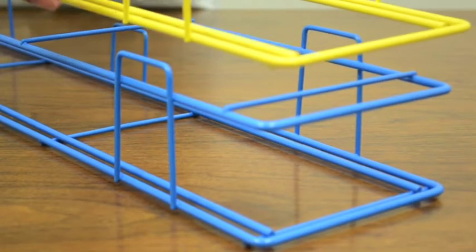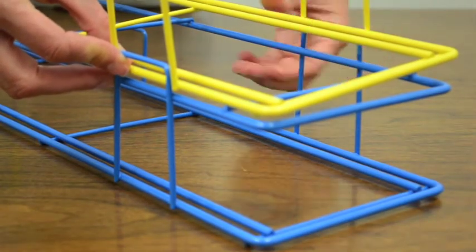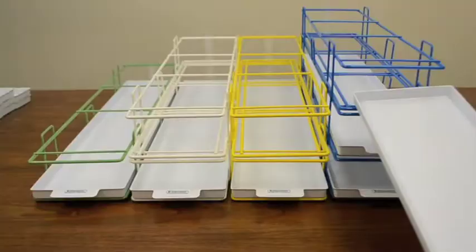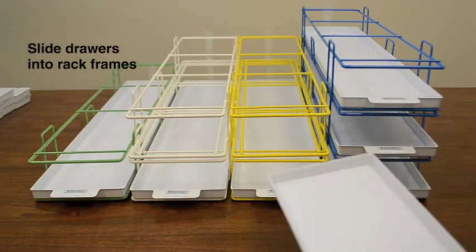Vertical stacks do not have to be built to the same height, giving you the ability to customize to your needs. Once your rack frames are assembled, slide each drawer into place.